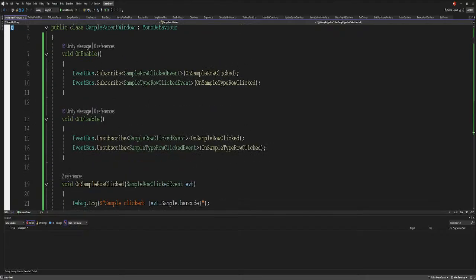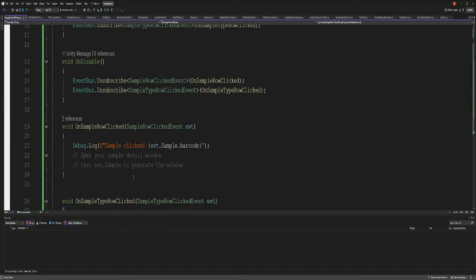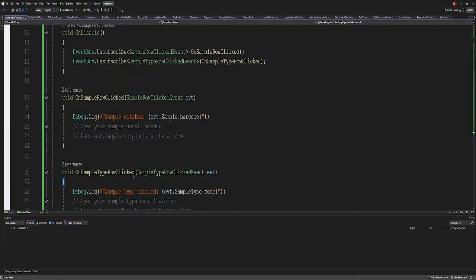What you're doing is subscribing to the event, right? So whenever anybody presses a button, it's going to read that. It's going to say on sample row click, and I hurried up and did it for sample type as well. And you want to open your sample detail window right here, and then pass the data. Does everybody got that? When we click on the row, we tell the row to send a message, and he's going to listen for that message and open up the window for you. Once he opens the window, he also inserts the data for that row, so you can see that data in that window. Very easy, right? The reason we have to do that is because when you run the query, those objects are dynamic. You can't just click and drag into the event. You have to do it programmatically through the algorithms.